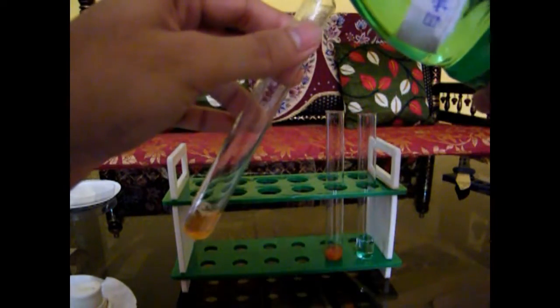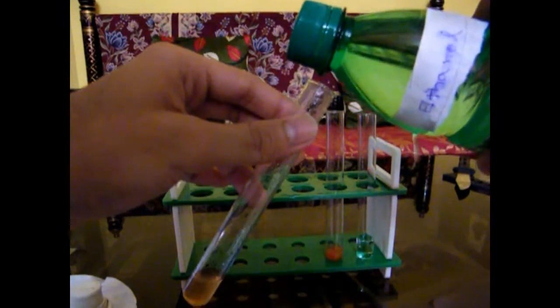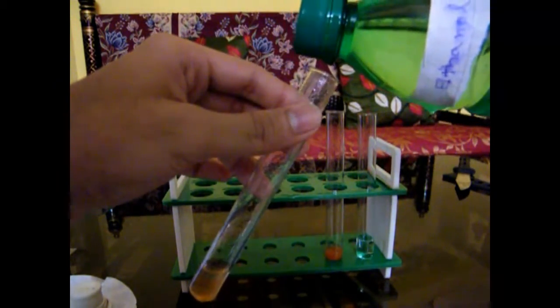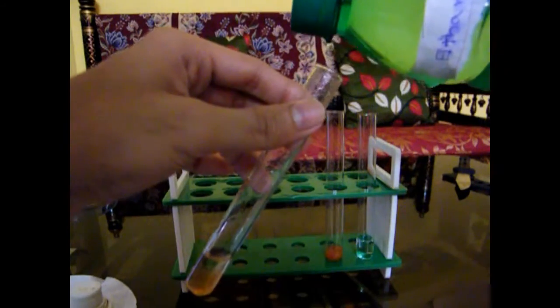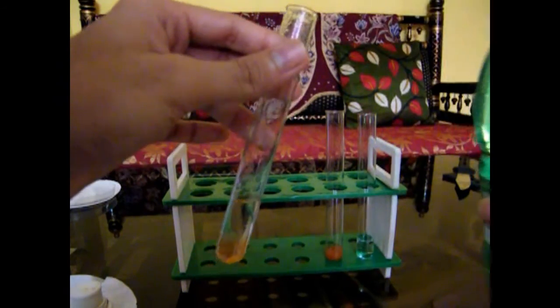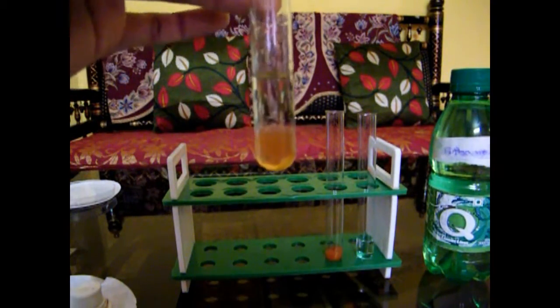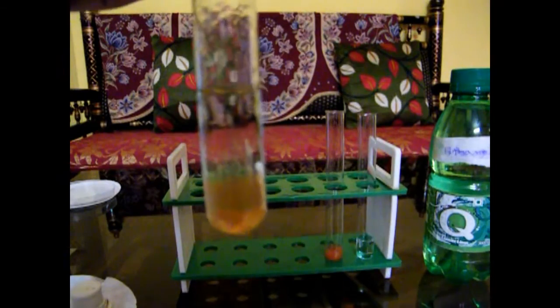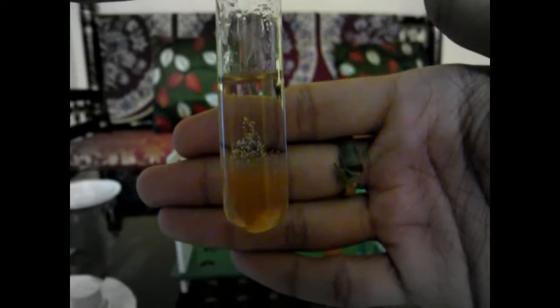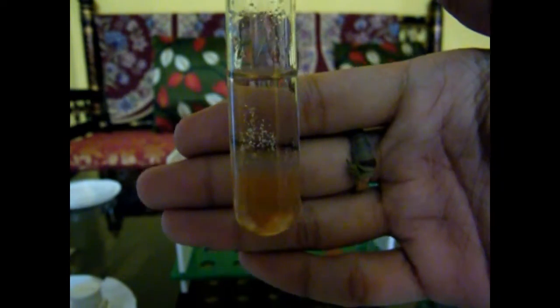Let's do it gently. The amount of ethanol used should be approximately equal to the amount of solution. We can already see — can you see these white bubbles floating up? These are basically the DNA strands coming up from the tomato layer into the lighter ethanol layer. If we allow it to settle for some time, you will see DNA strands accumulating on top of the ethanol layer.